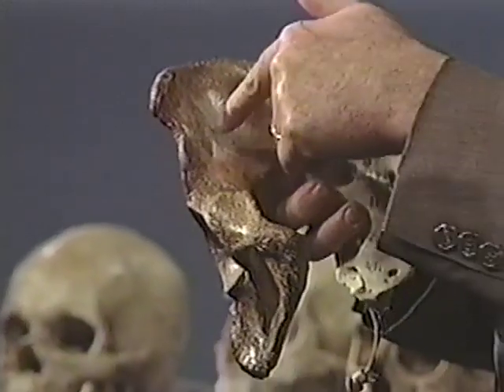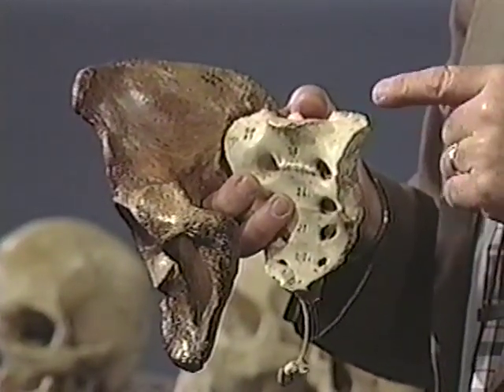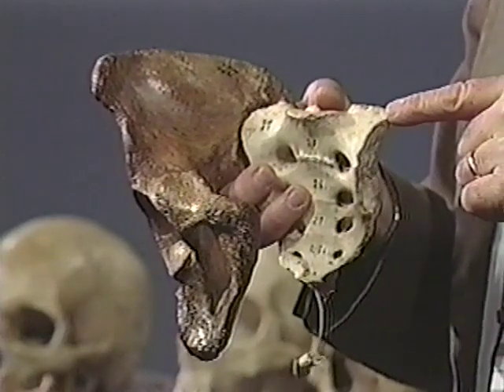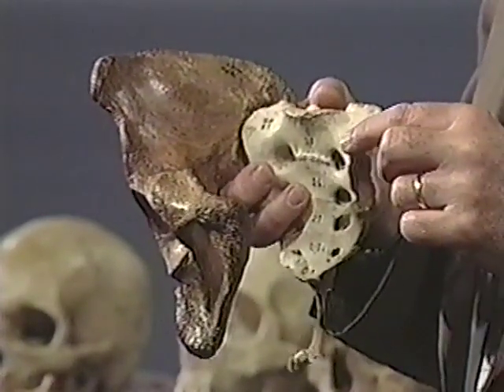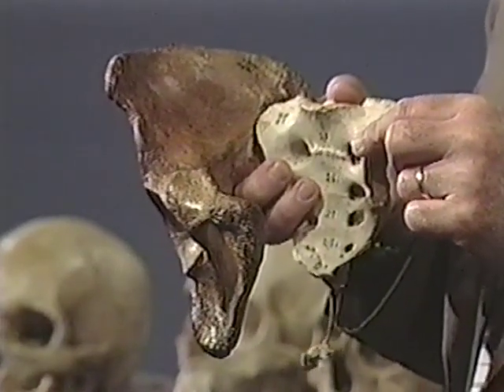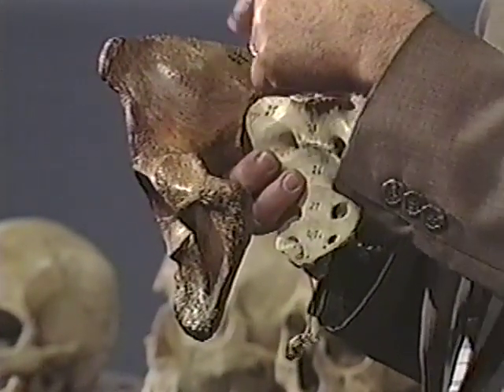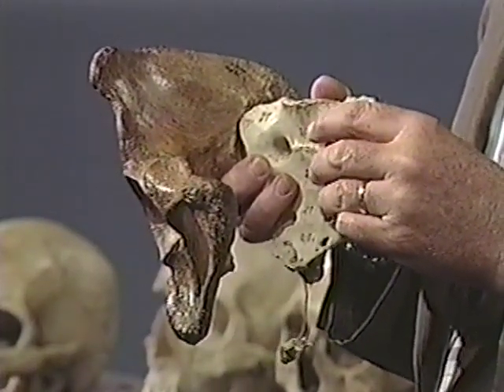Where the white bone and the brown bone come together is the sacroiliac joint. Now, the reason there's a difference in the color here is because the sacrum, which is white, has been bleached. It's a biological supply house specimen. And the innominate over here, the brown bone, is one that came in from a police case, and this individual had been buried, and we cleaned it off but did not get all the dirt out of the little pores down in the bone, and this is what caused the bone to be brown.